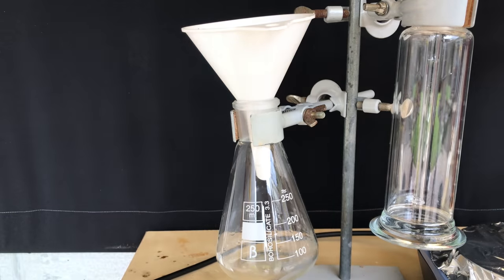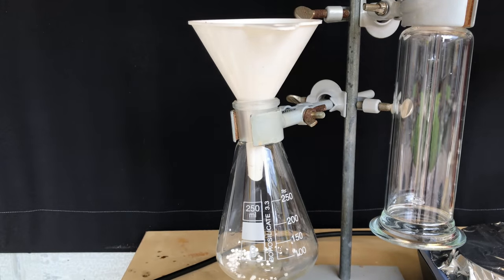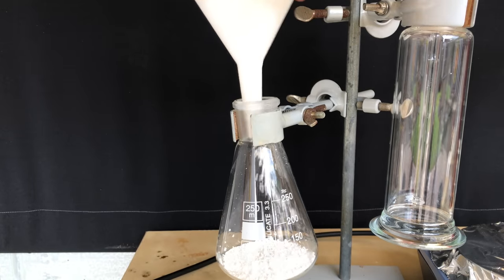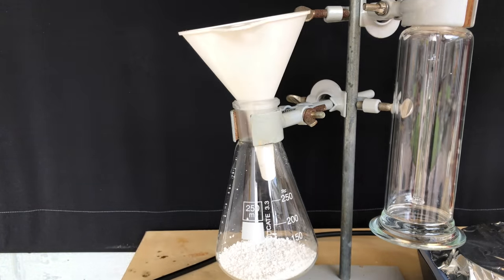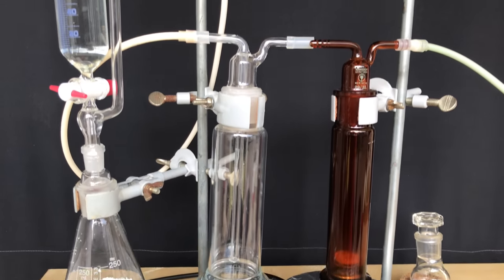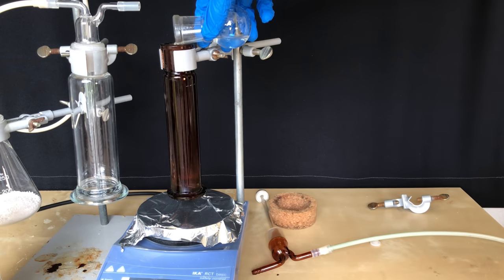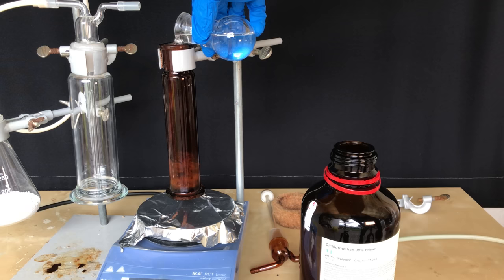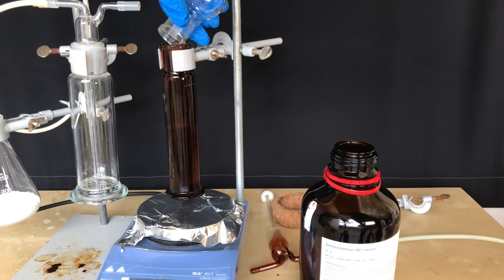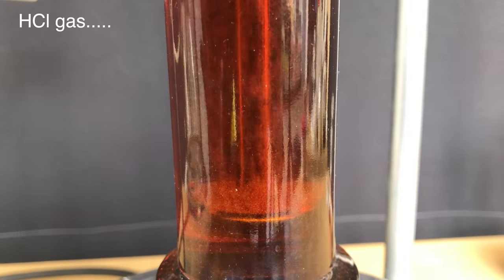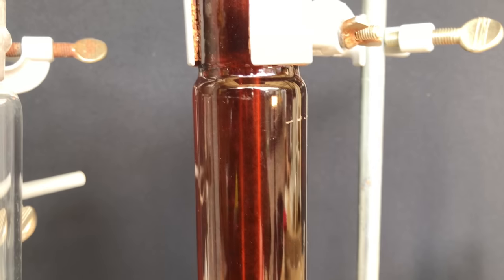For the addition of hydrogen chloride, we used a massive excess of this gas. I didn't calculate how much gas we needed exactly, but ended up using about 70 milliliters of 37% hydrochloric acid and 70 grams of anhydrous calcium chloride. Just in case if the liquid got sucked back through the straw in the second washing bottle, another one was added to prevent suck back into the apparatus. The atropic acid methyl ester was added to the brown gas washing bottle alongside a lot of dichloromethane. The dichloromethane will act as an inert solvent. When the hydrochloric acid contacts the anhydrous calcium chloride, hydrogen chloride gas is liberated. At some points you may need to heat the flask containing the drying agent in order to drive off more HCl, but you could also use concentrated sulfuric acid.